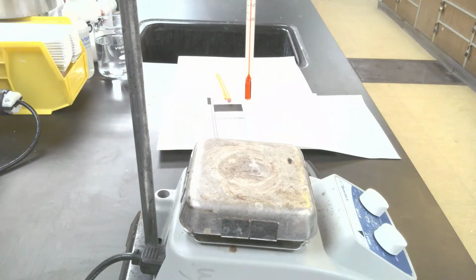Today's experiment deals with Hess's law. Hess's law basically means that if a reaction takes place in one step, it will have a delta H value. If it takes place in 2 steps or 3 steps, etc., the delta H value will still be the same. So the sum of those values will equal whether it's 1 reaction or 2 reactions or 3 reactions. So that's what we're going to determine.